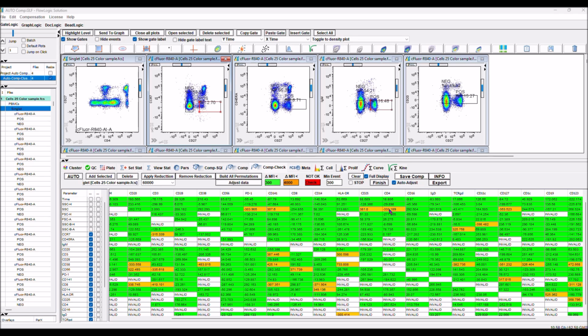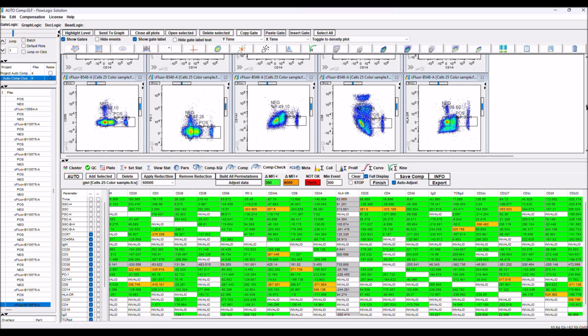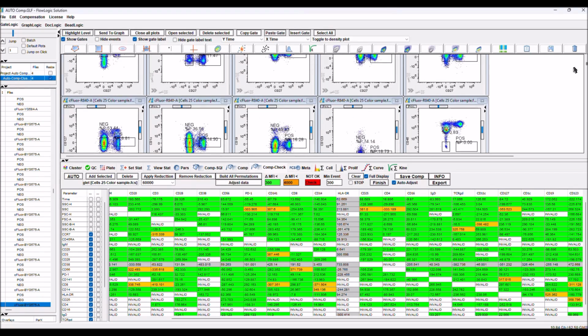orange to verify, and we have orange because the gate was in auto adjustment mode, so the gate was moving toward the end. So now the gate is collecting all the data. There is minimal difference apart from this one, that is 700. If we are happy with this, we maintain and leave it as it is, and we don't need to do anything. We think that we are okay.